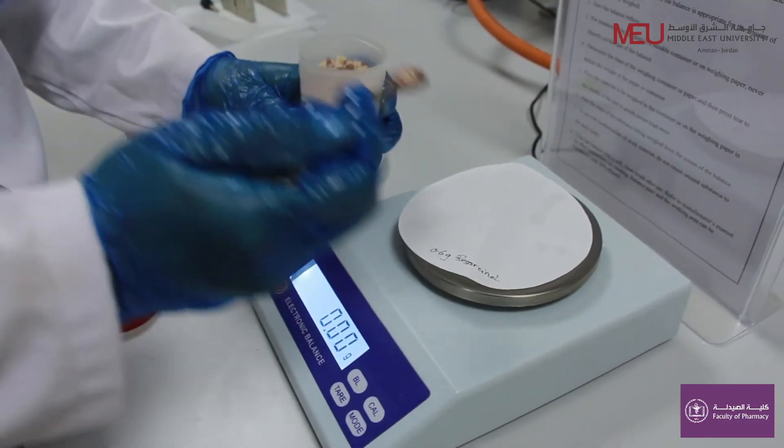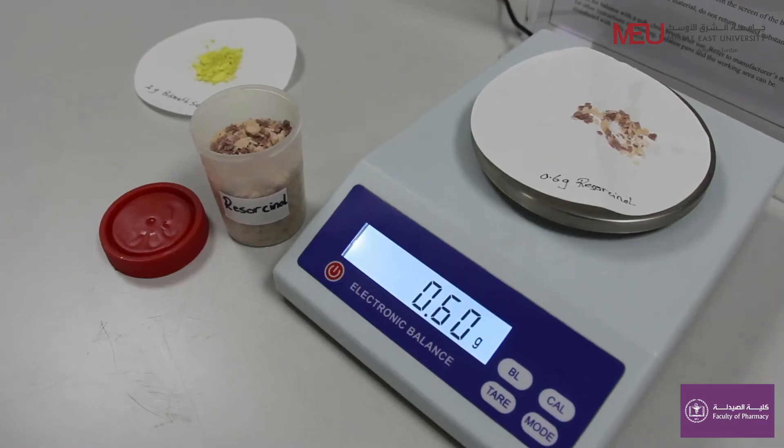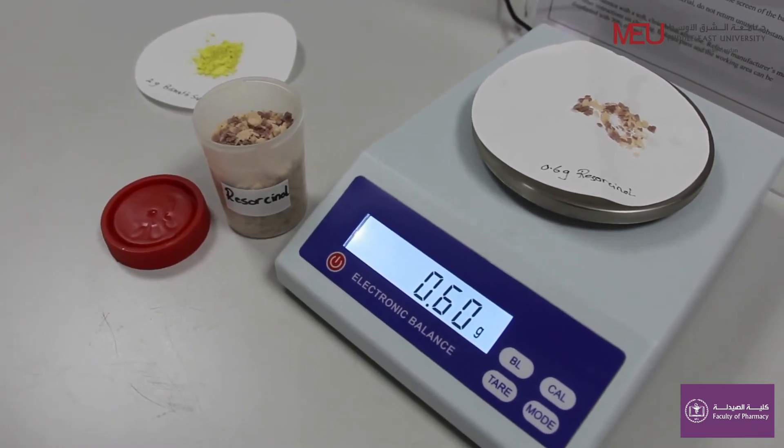Weigh 0.6 gram of resorcinol which is used to treat the itching and as a disinfectant.